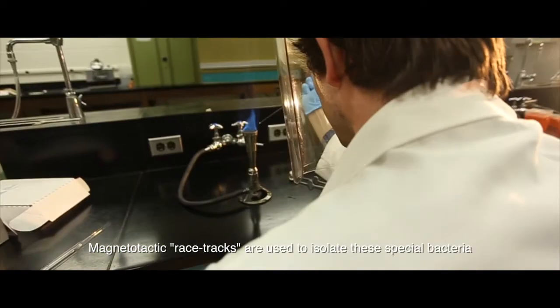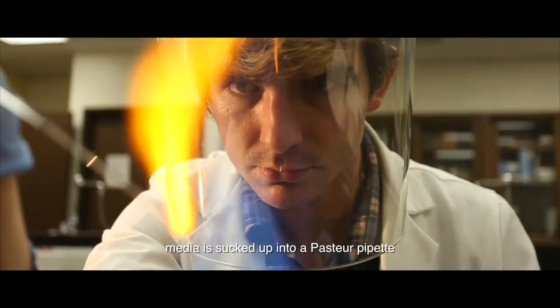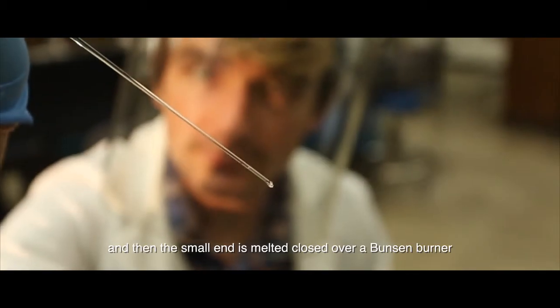Magnetotactic racetracks are used to isolate these special bacteria. Media is sucked up into a Pasteur pipette, and then the small end is melted closed over a Bunsen burner.